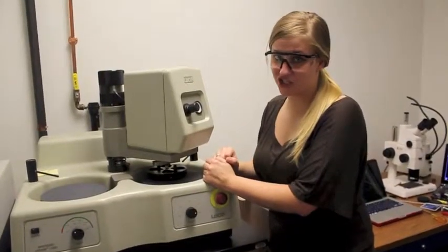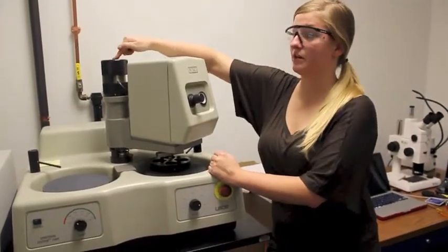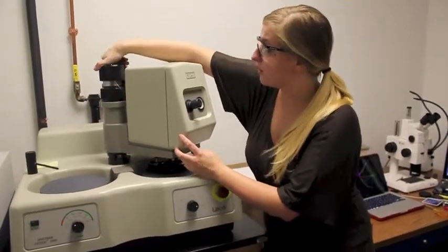In order to lower the polishing head and secure the sample mount, you will want to rotate the post behind the head clockwise completely.